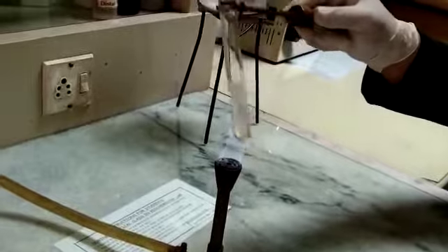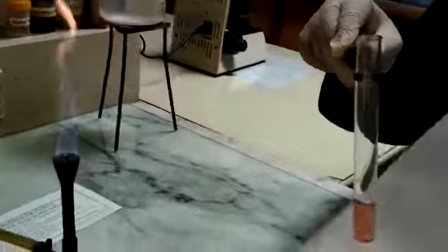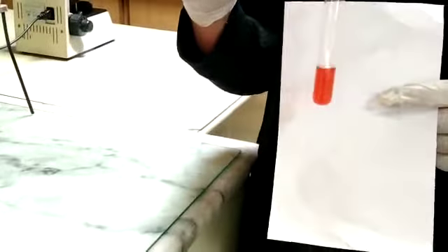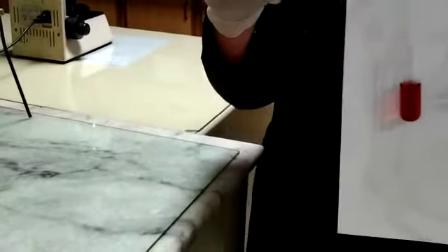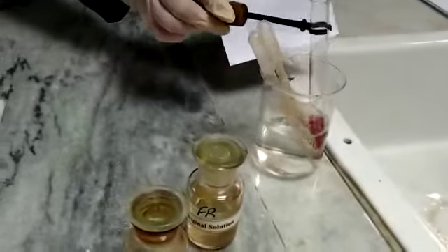First the color will turn pinkish — you can see the color has turned to pink. This is in hot condition. When it cools, the color will turn to cherry red gradually, as you can see the color is turning towards cherry red.